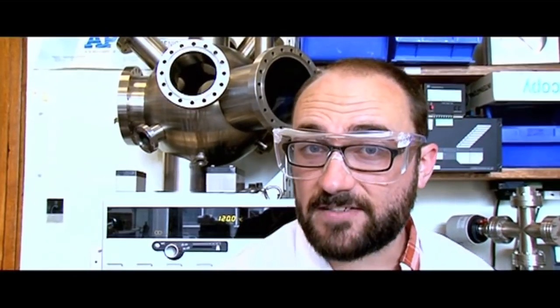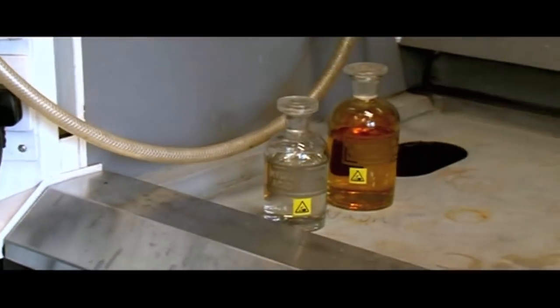If you have a bunch of gold laying around, the likelihood that it will dissolve or rust or evaporate is very low. One substance discovered in the 1300s with the fancy name aqua regia is made out of hydrochloric acid and nitric acid, and we're about to make some right now, thanks to Neil from Periodic Videos.